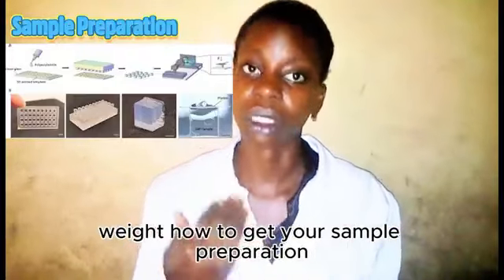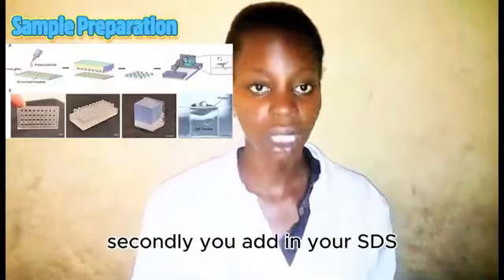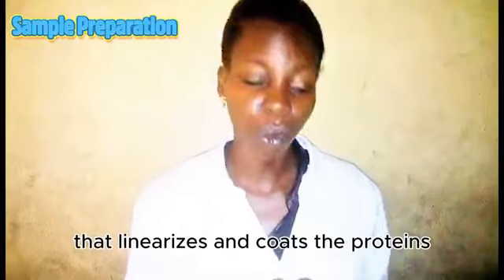How to get your sample preparation? That's how to mix it. First, you add in your Tris-HCl. This Tris-HCl is the buffer system. Secondly, you add in your SDS, that's sodium dodecyl sulfate. It's an anionic detergent that linearizes and coats the proteins.